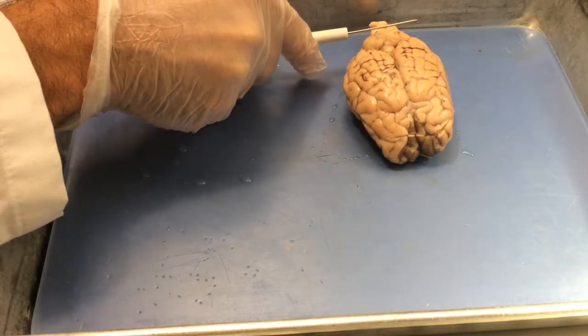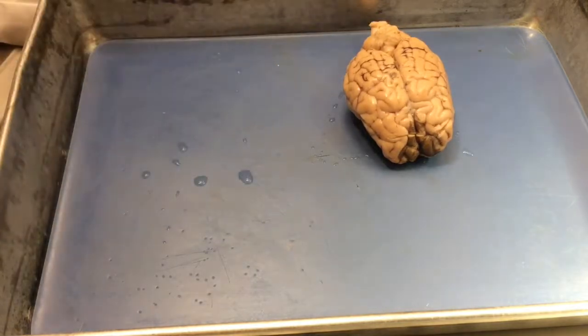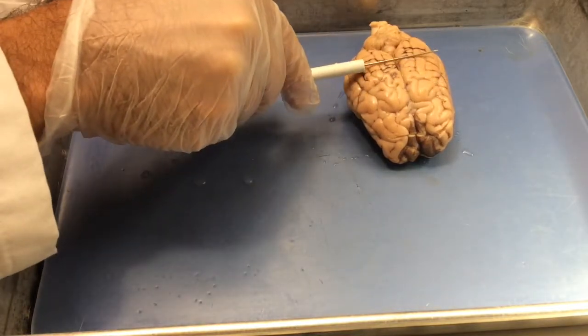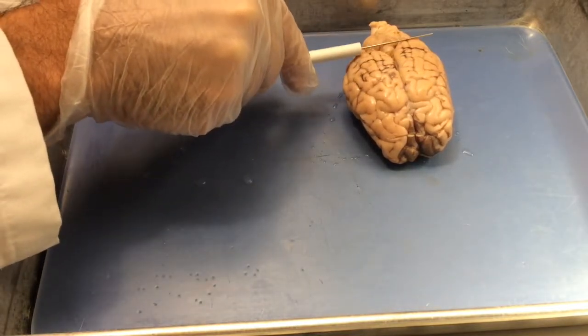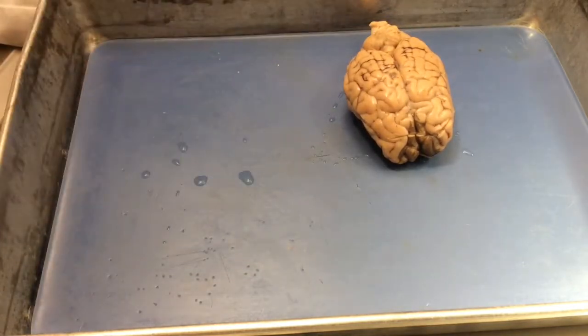Structures in the posterior part of the hindbrain, the cut plane being right here, and then the spinal cord. We'll look at the spinal cord in coronal section as well. So there are 6 total sections that I'm going to be showing you: anterior forebrain, posterior forebrain, midbrain, anterior hindbrain, posterior hindbrain, and spinal cord.